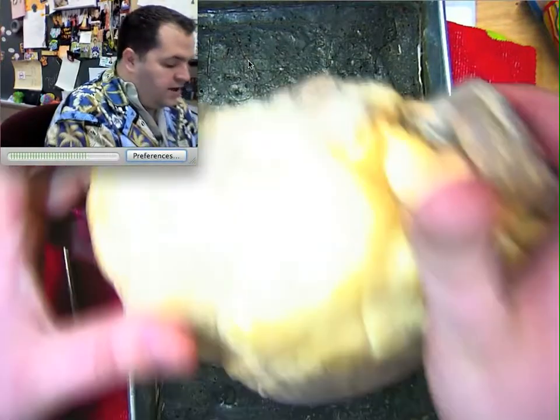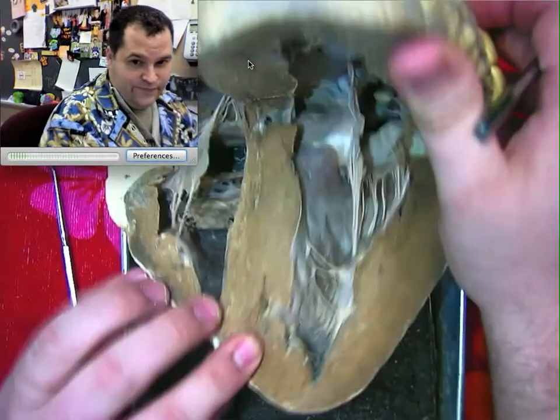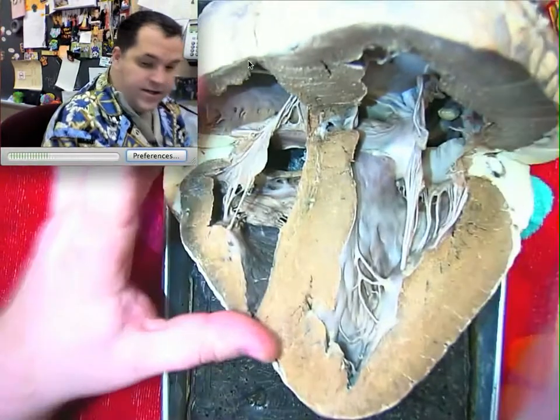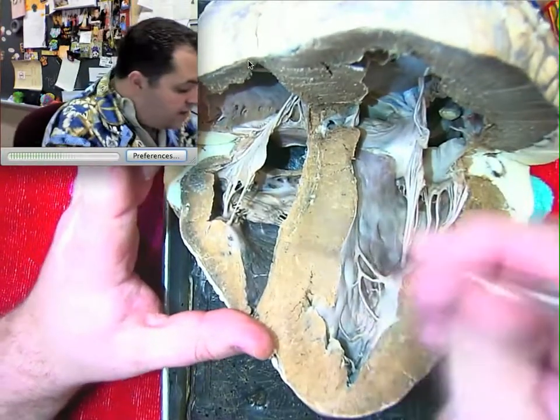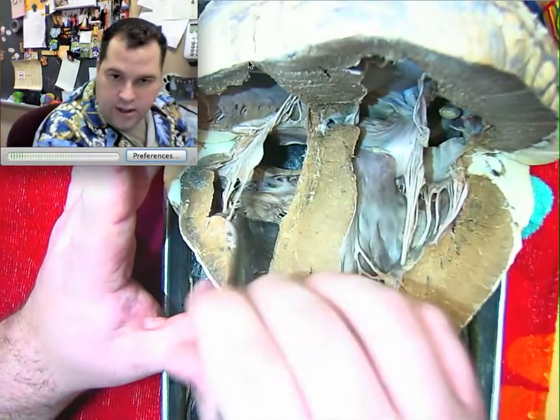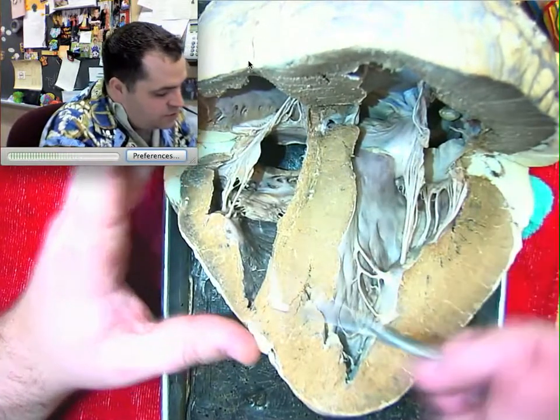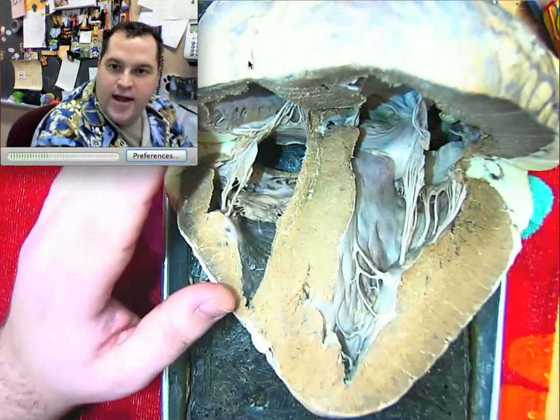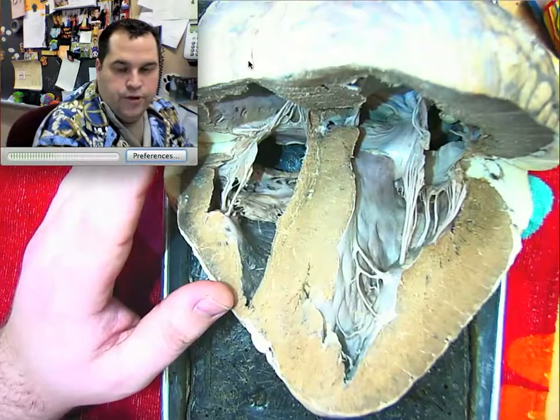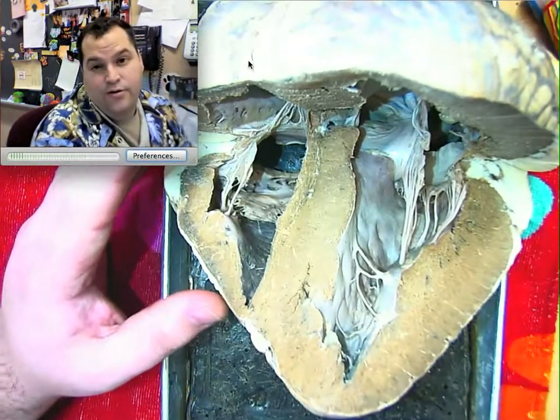Now, what I've done is a coronal dissection, so I can actually flip this up, and we can take a look inside. Now, if we take a look in here, there's a lot of things going on. This large muscular opening here is, of course, the right ventricle. I want you to notice something too. Remember how we said that the right side of the heart is responsible for pushing blood to the lungs? Well, the lungs are right next door to the heart.